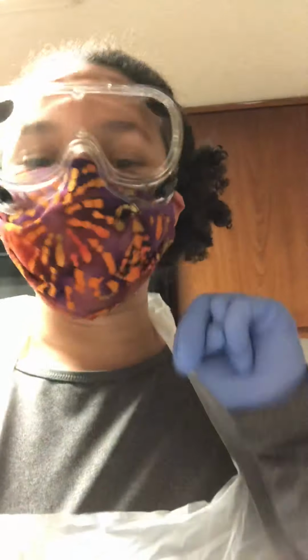So thank you guys for tuning in this week. I'm going to disinfect my working area with 10% bleach and also soak the test tubes in pure bleach for 2 hours before disposing in a trash can.